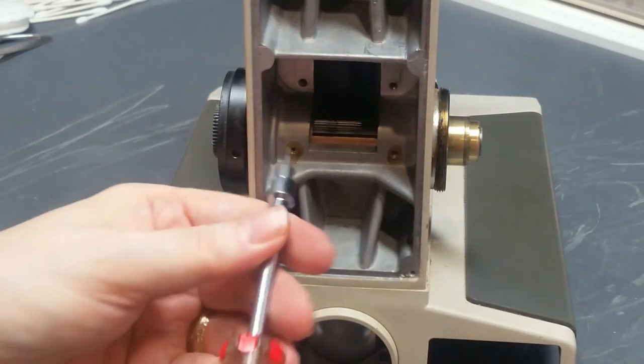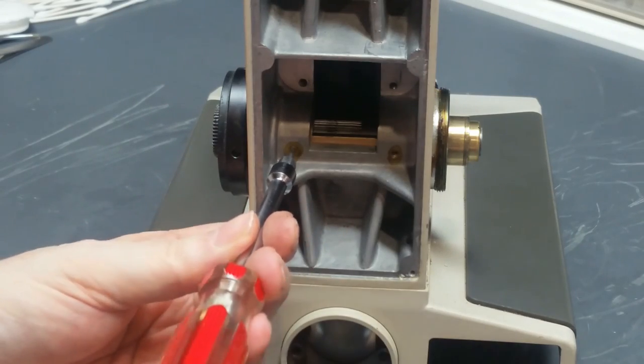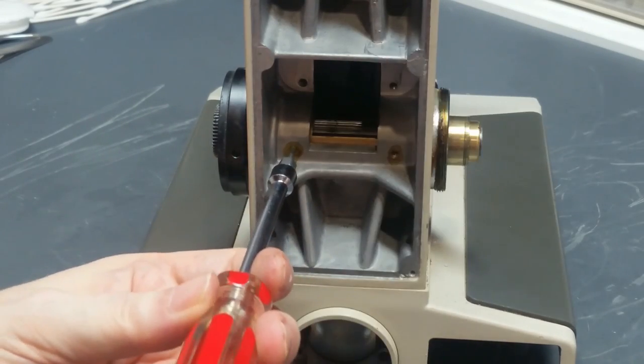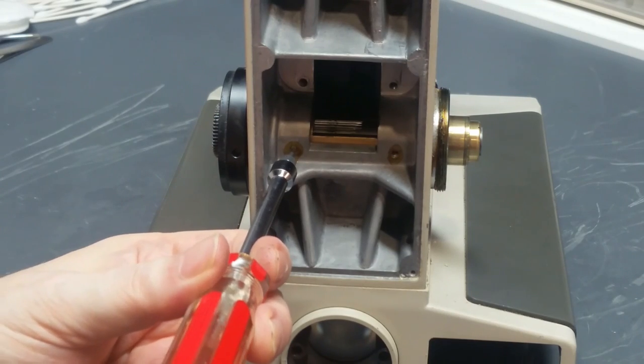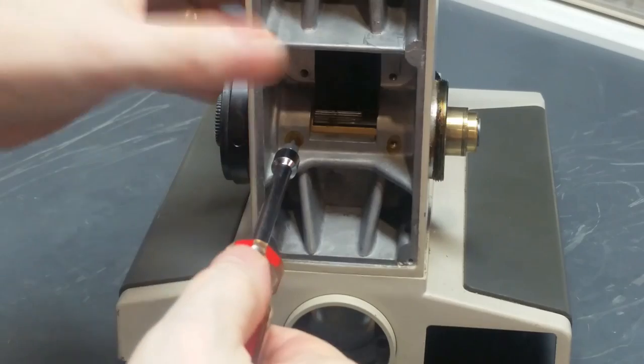Put that aside and we do the same thing to the next one. So like here, I cannot feel where the head's starting to engage, so I'm just going to lightly tap and turn. There, it started to go in. Now she's in there.